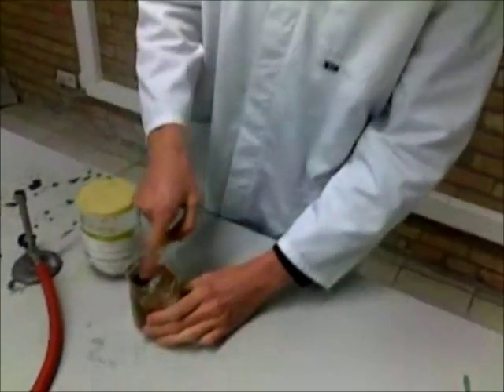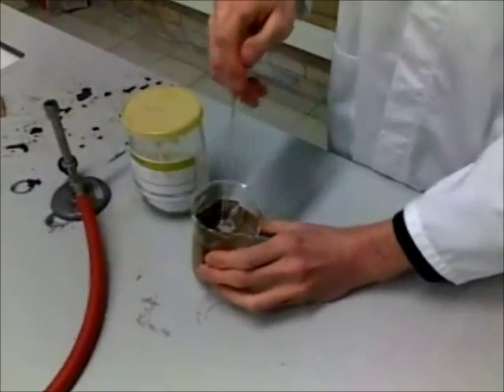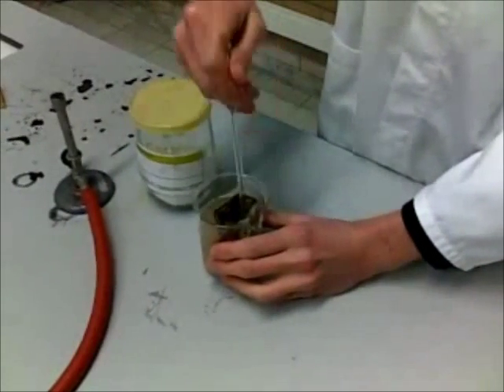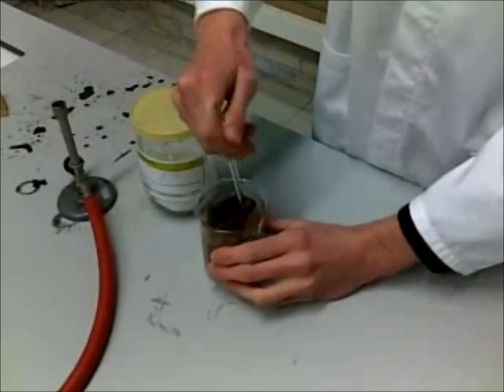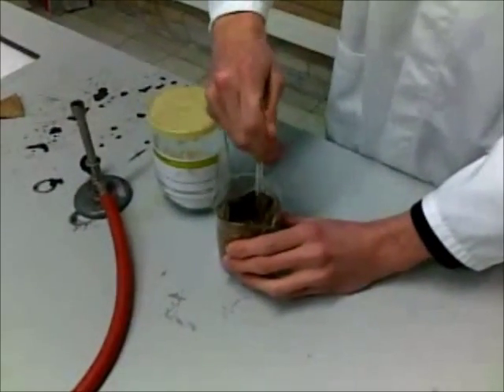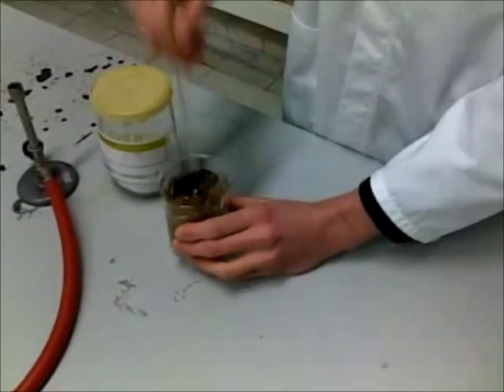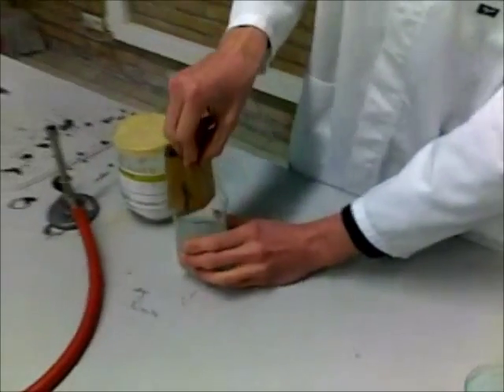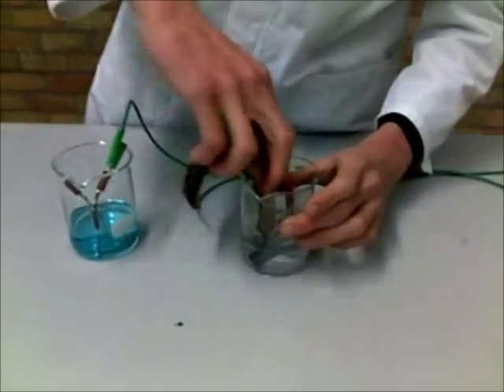All right. Make sure it isn't too wet because you can mix up the chemicals. And just put it in on each side, in each jar.